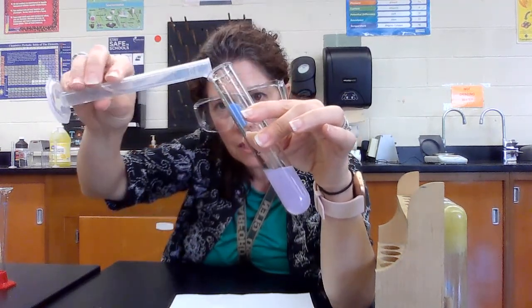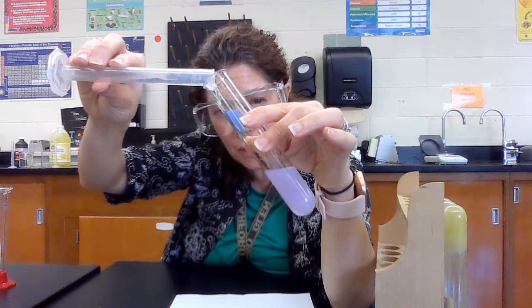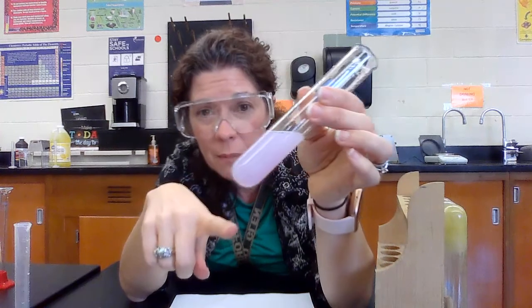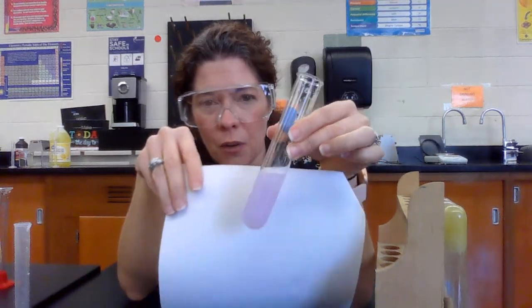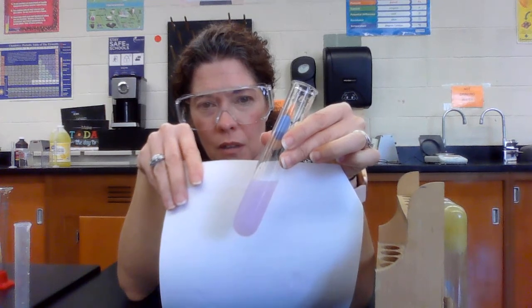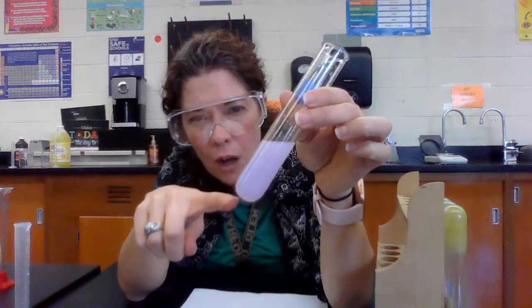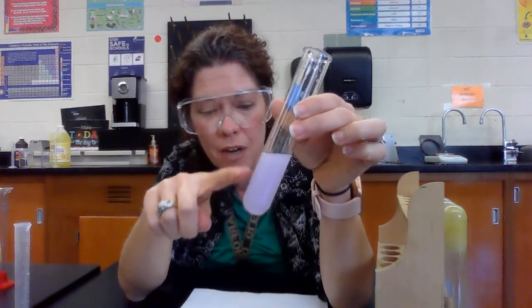I'm going to put the rest in and you're going to see that this clear liquid is now very cloudy. There is a precipitate in there and it has a little bit of a purplish color if I hold it on this piece of paper behind it. So it went from that pale green to a little bit of a purple color — it's cloudy because there's a precipitate in there.